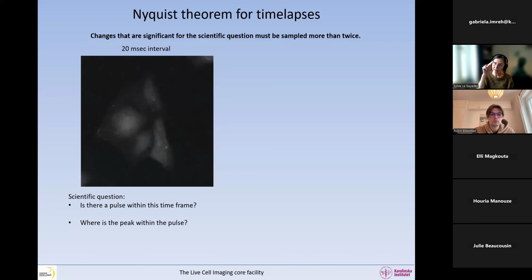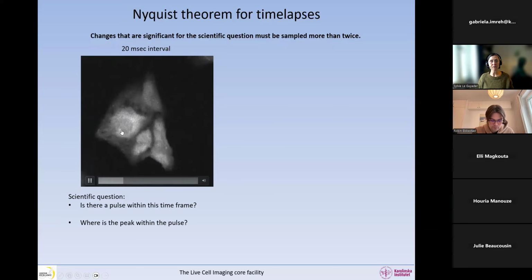So how long does it take to peak, right? These are our scientific questions, and now we're trying to figure out what interval I should use, how much time between my images. If I have a 20 millisecond interval, this is what I'm seeing. Within my time lapse here, I have one pulse. Then if we look carefully, maybe we can define where the peak of the pulse is. So maybe we would say here is the peak of the pulse. So we're quite precise in knowing.